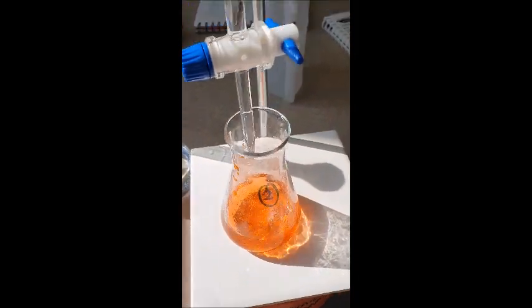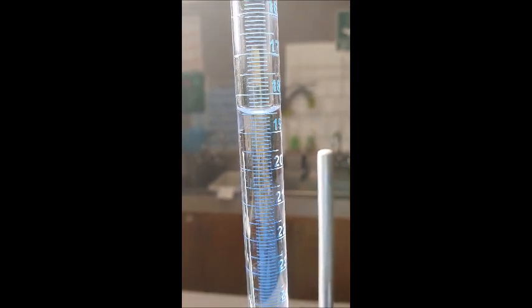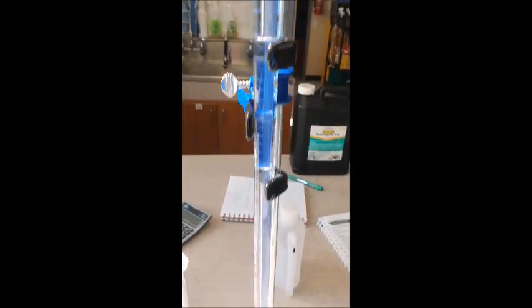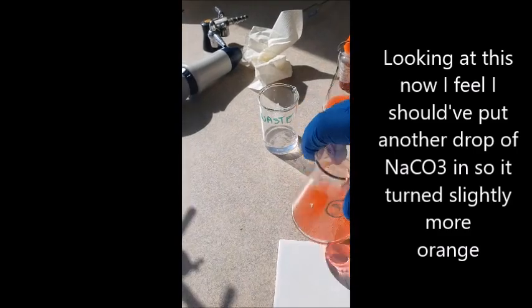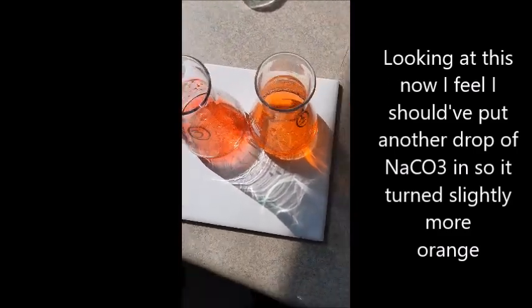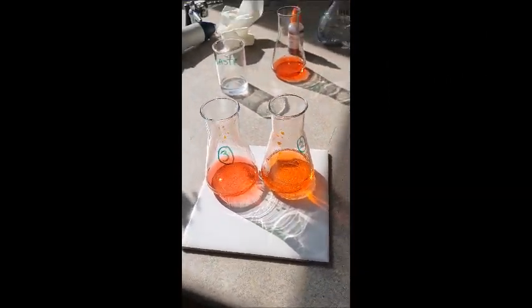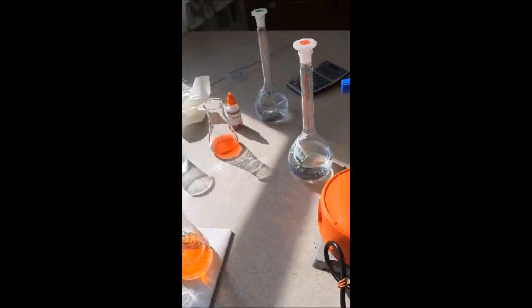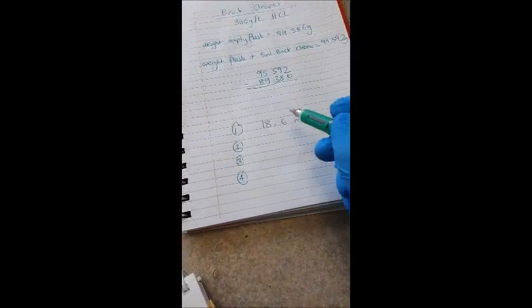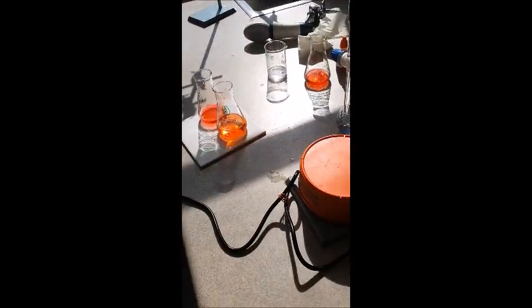18.5. So it was a little bit faster. So you can see the difference in color. So this one is more orange and that one is red. It's easy to see in person. Number two is 18.5 mil. Well, that's pretty damn concordant. Let's do number three.